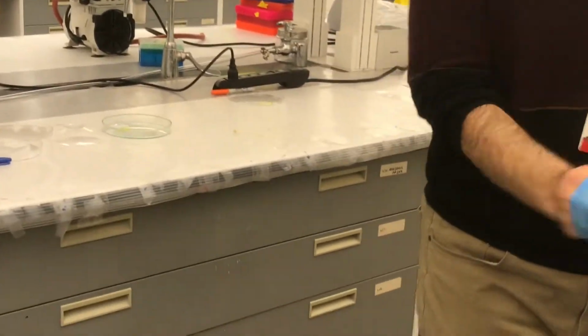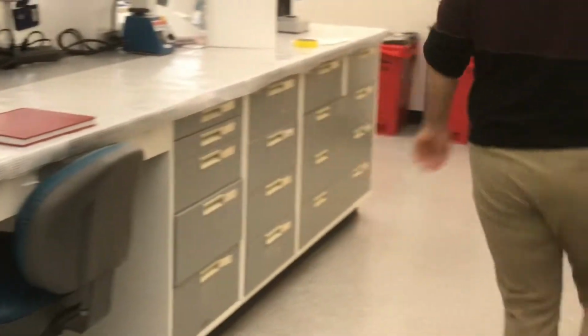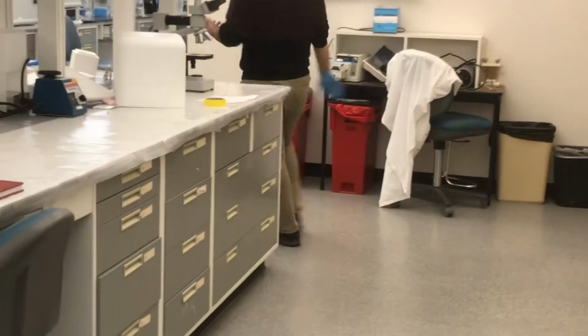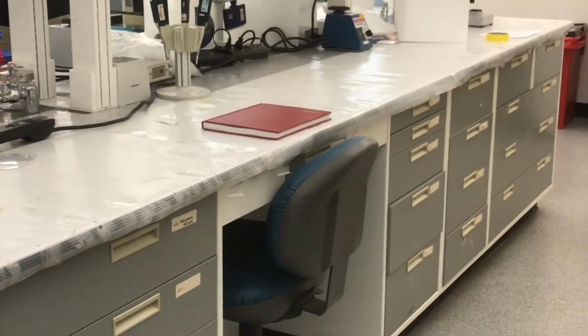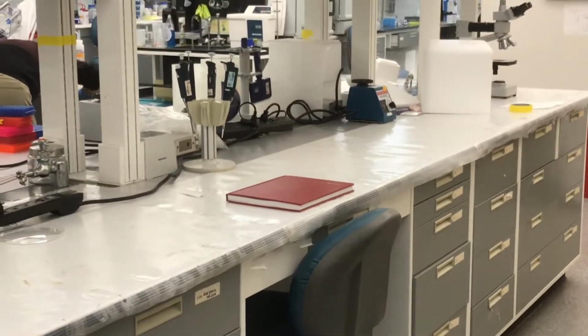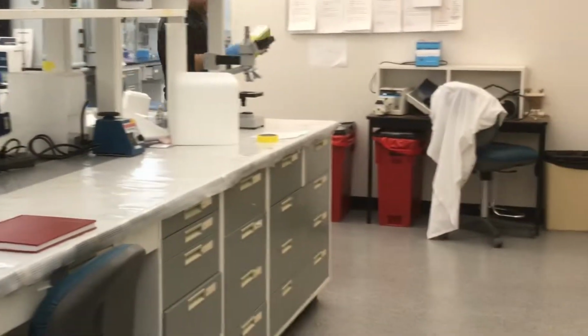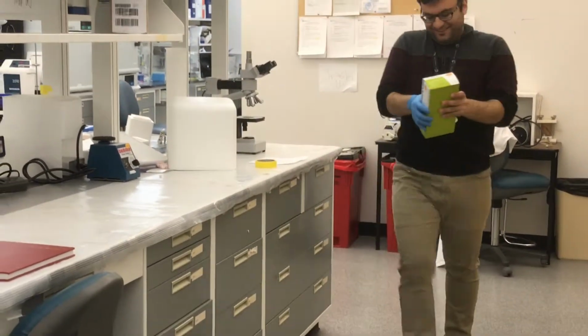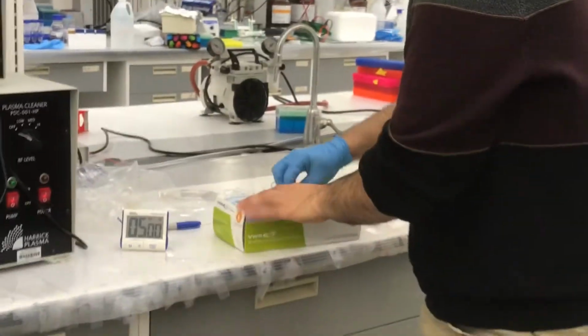So just this part, why do you put gloves on now? You should have started with gloves earlier. No, but at first I had gloves, but after that I removed them. So if I put this on YouTube, they will say, okay, the teacher did not have gloves and he did not put a lab coat on.